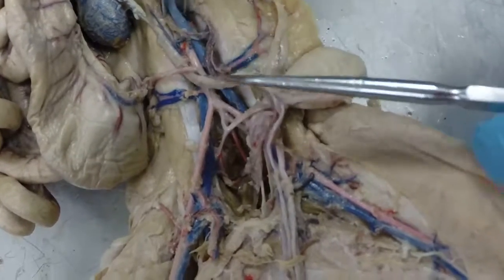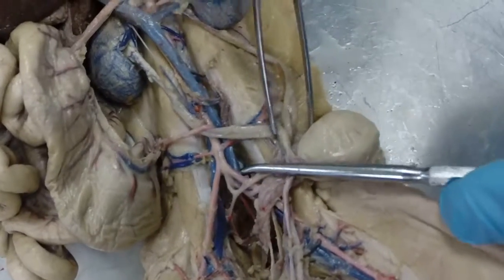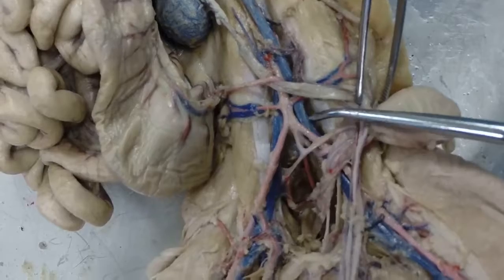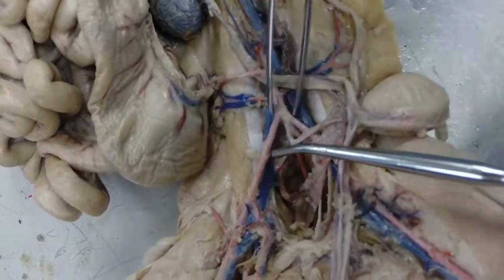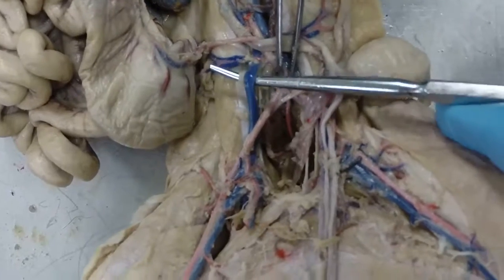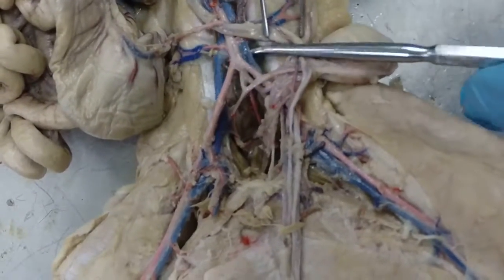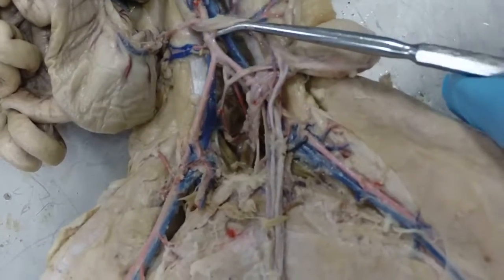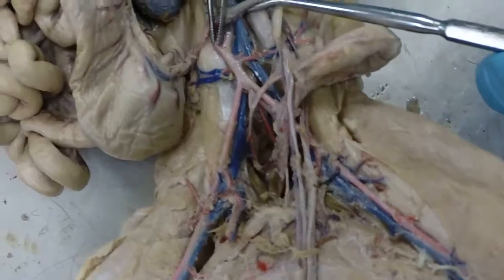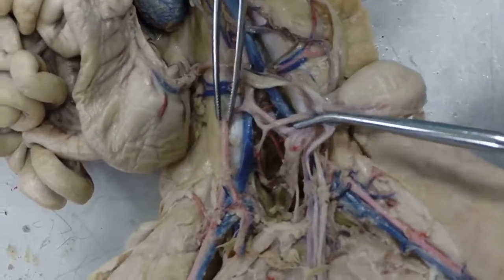And then when it comes to the postcava branching, we have a little bit of a different branching pattern. So this postcava is going to branch right here. And the first two branches, these are called the common iliac veins. So this would be a right common iliac vein. This would be a left common iliac vein. And you can see maybe where they branch off the postcava right there. Okay, the common iliacs are going to branch again.